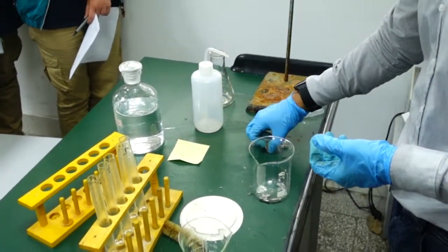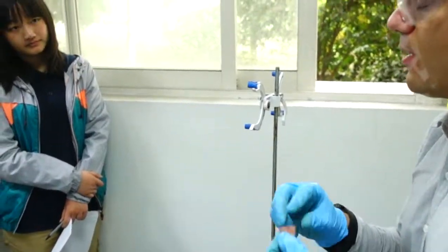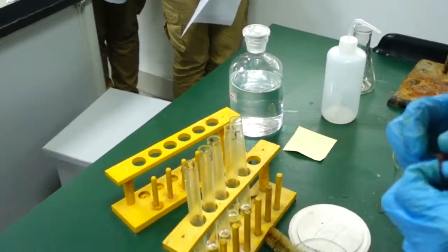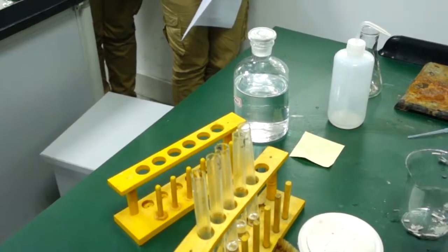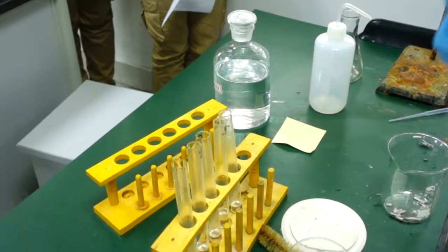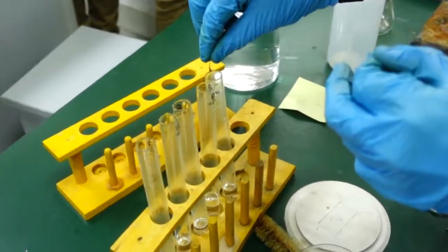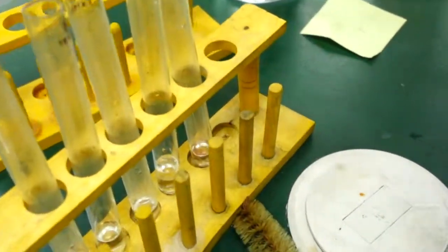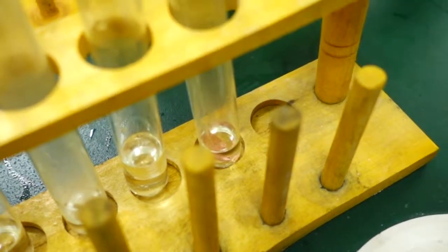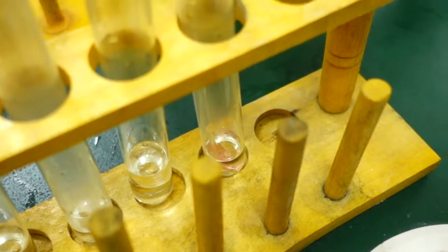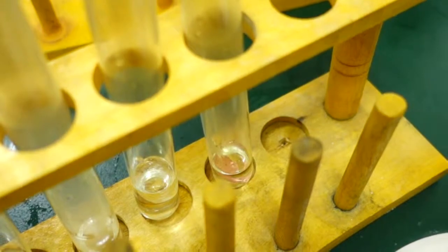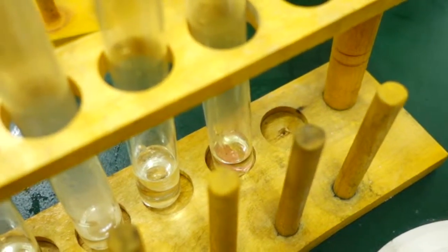I'm going to add each metal. Remember what this one was? Copper, metal C. Maybe I need to cut it a little smaller. We couldn't find the scissors before, I'll tear it. Any reaction? We don't expect any reaction with this one.